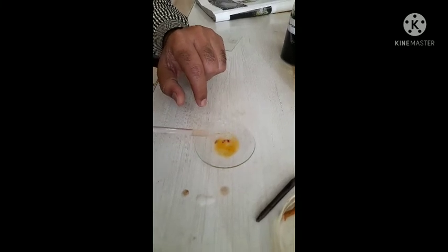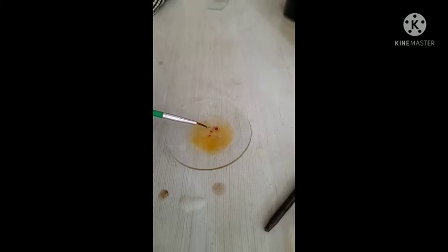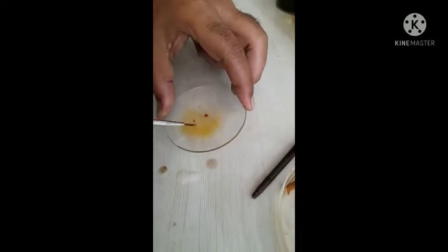Treat the section for at least 5 minutes. After staining, it gives pinkish-red color in the xylem and phloem region of the section. When adding iodine, use just 1 to 2 drops, otherwise the section becomes bluish or blackish. Stain it for 5 minutes, then discard the staining reagent from the watch glass.